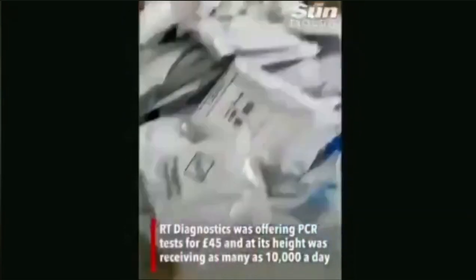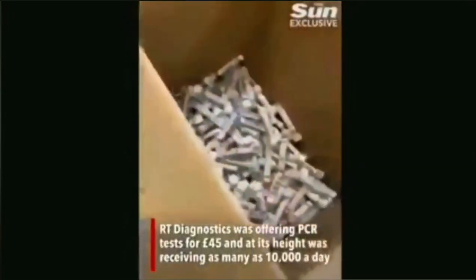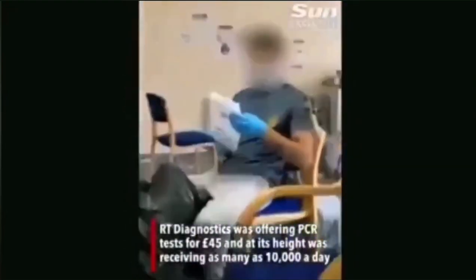This is how you work, live coronavirus is coming through, we sat here with just mask, gloves.